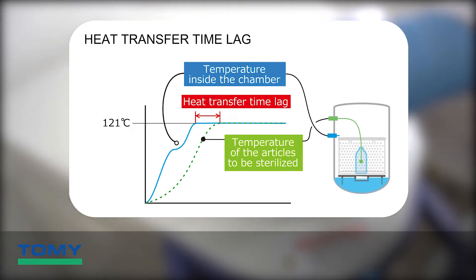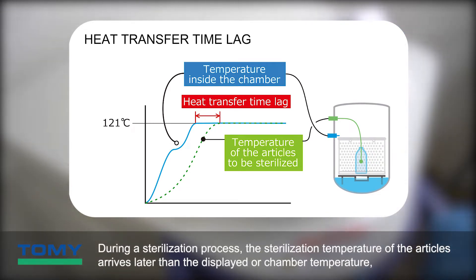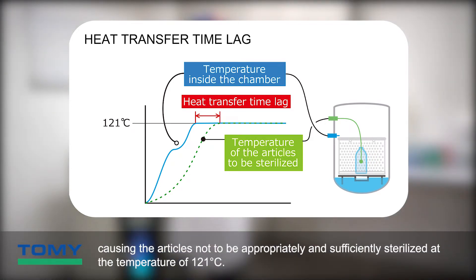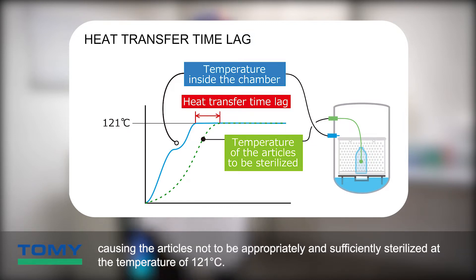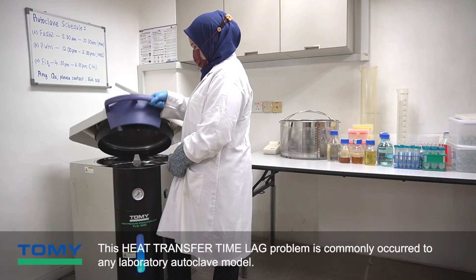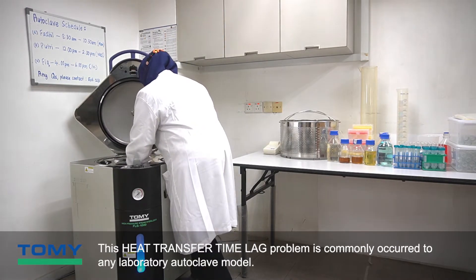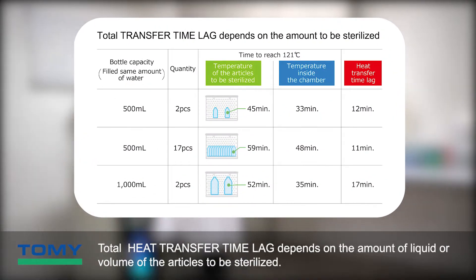During a sterilization process, the sterilization temperature of the articles arrives later than the displayed chamber temperature, causing the articles not to be appropriately and sufficiently sterilized at 121 degrees Celsius. This heat transfer time lag problem commonly occurs with any laboratory autoclave model.